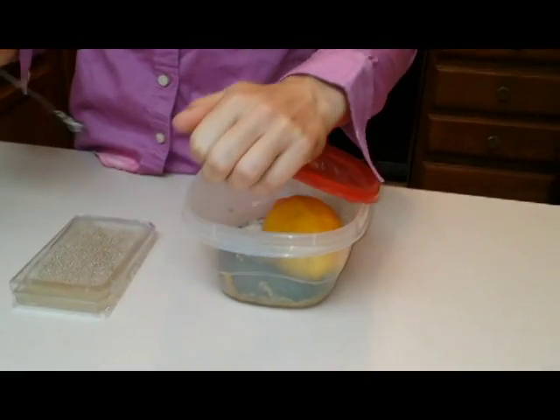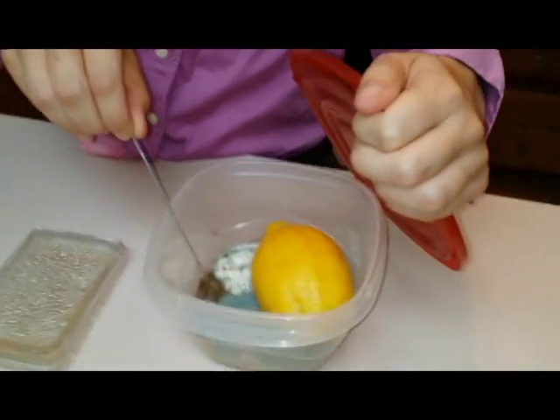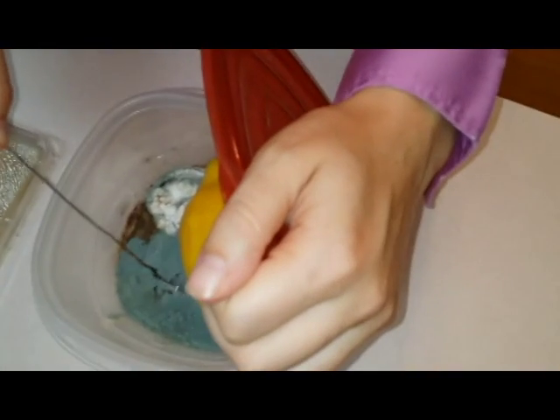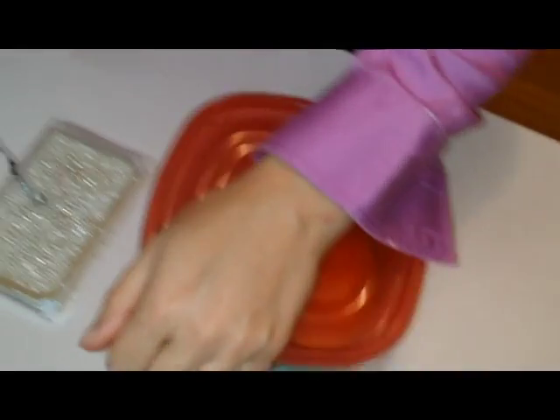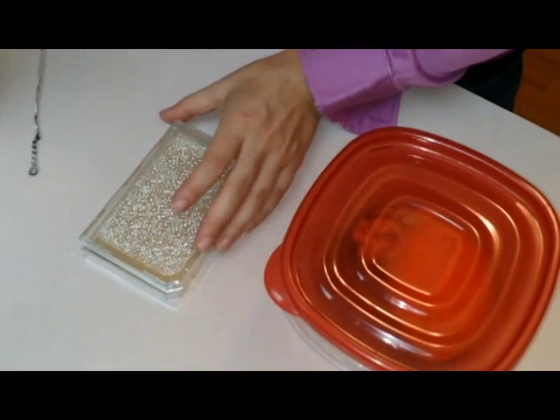And then we're going to open up this. Look at that, that is gorgeous. Pick up some of that. That used to be bread. Okay.